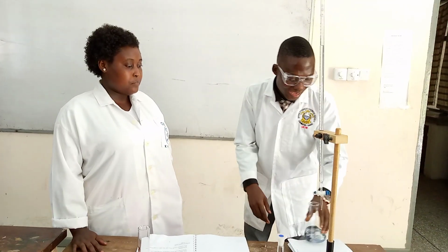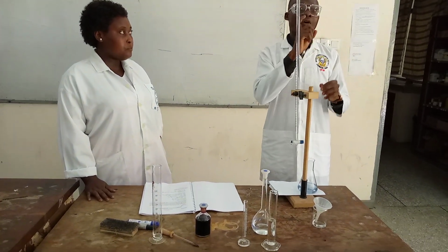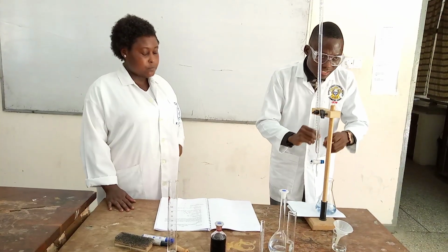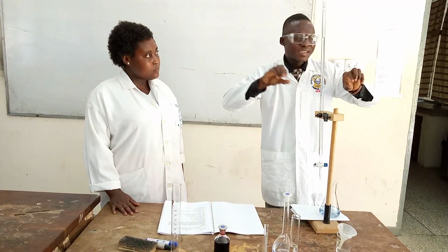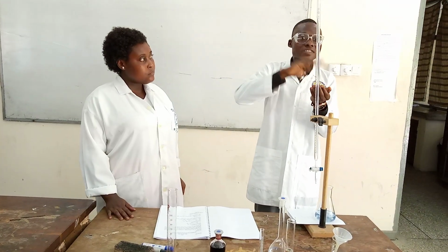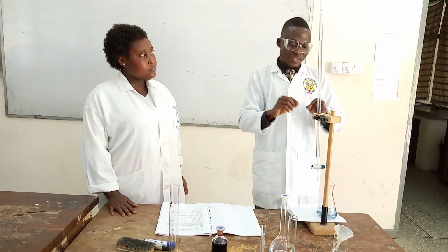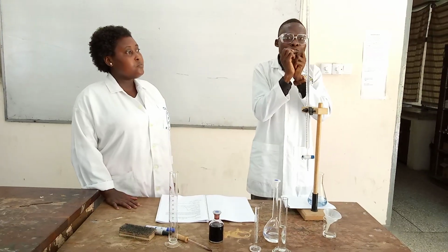Somebody might also ask why we didn't get the purple color. In this titration, even a single drop from the purple color can change it directly to blue. As I was doing it, it got to a particular point where I kept about 2 or 3 drops. So in that particular range the color quickly changed from red to purple and to blue. That is why we didn't see the purple color. The range is too small. Even half a drop can change it from purple to blue.